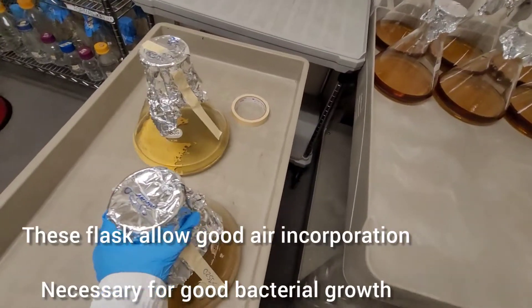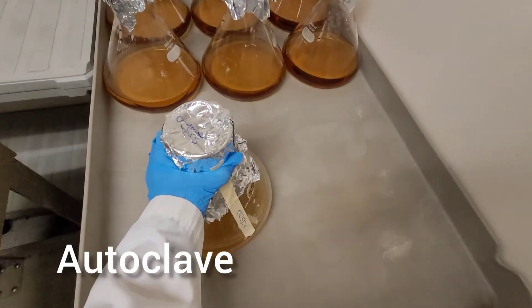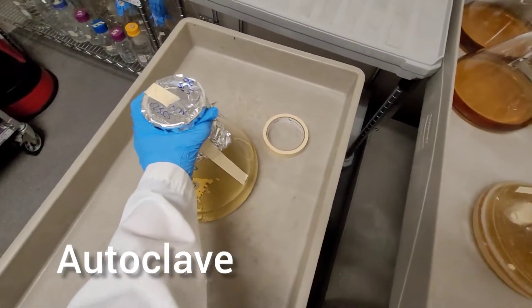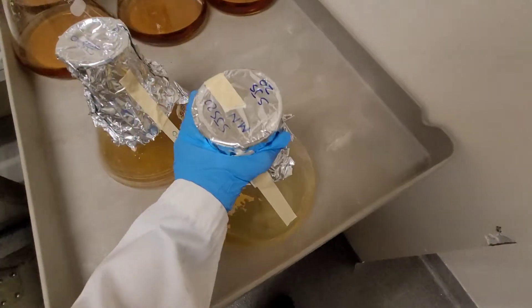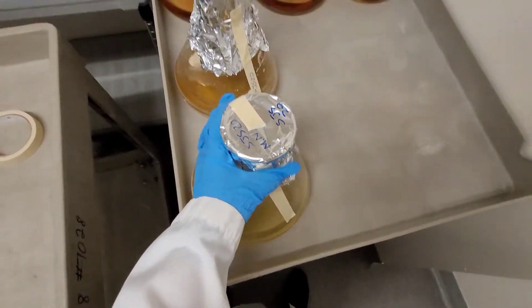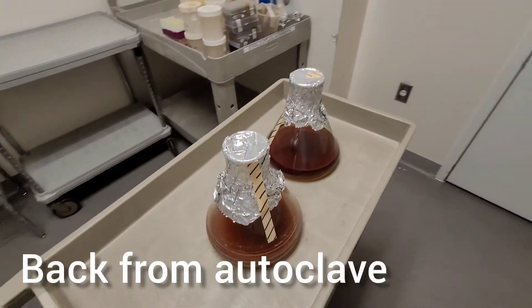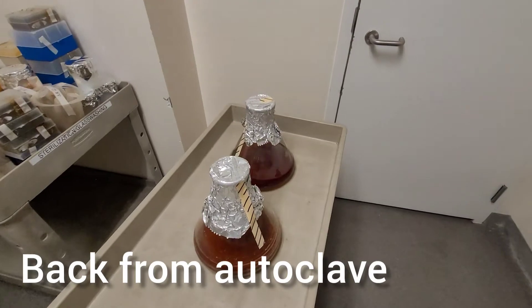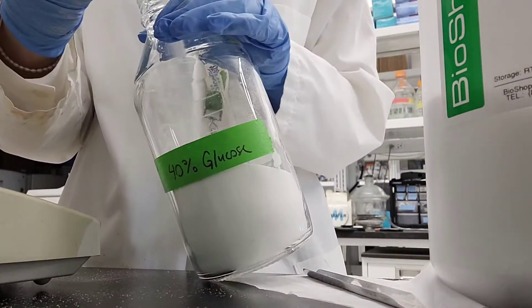Then you put foil and autoclave tape on them and then you either send them for autoclave or you do it yourself. In our facility, they do it for us, which is very nice. So here it's back from the autoclave.